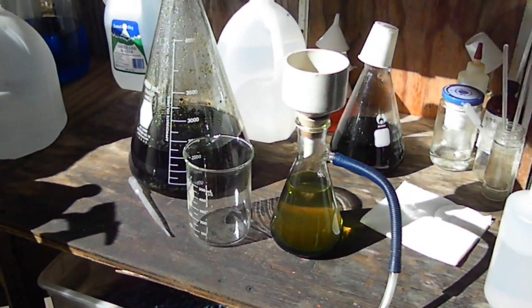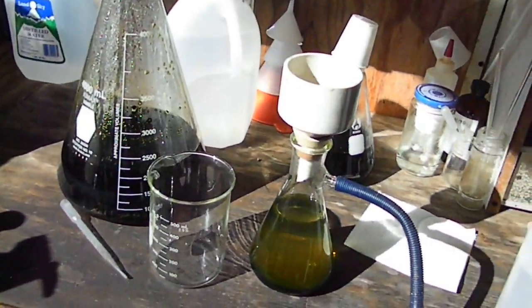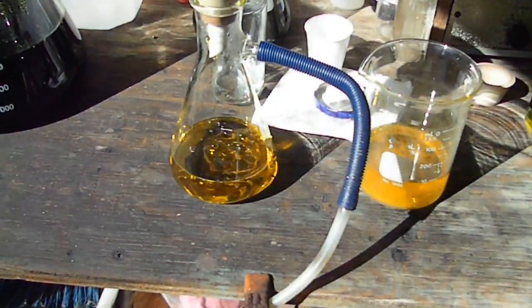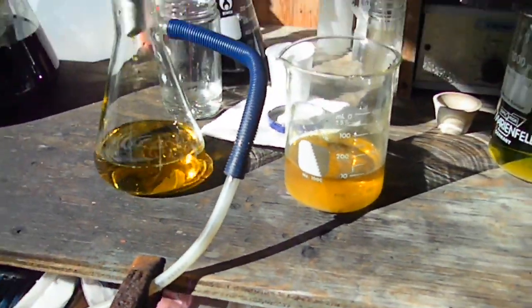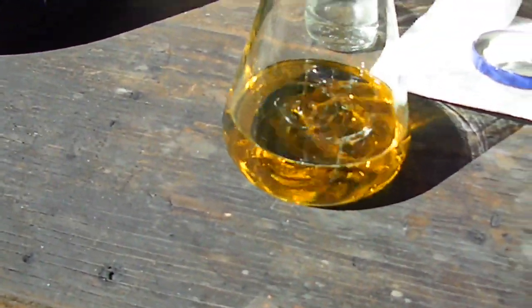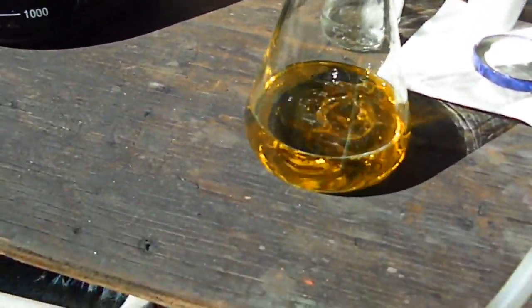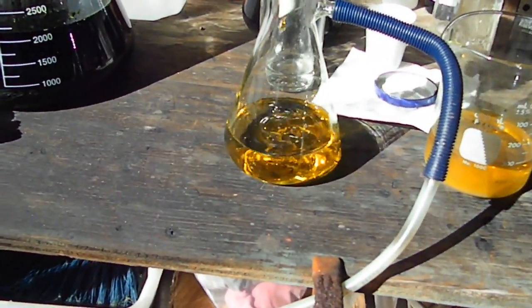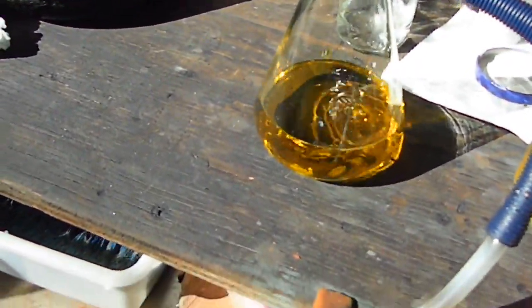It's still another couple more hours of filtering and then we're gonna get this stuff in several different beakers and get it dropped. I just wanted to pop in and show you - I think we've got some lead, probably some lead chloride, settling out. But you can see how hazy this beaker solution is versus what's coming through. This is actually our second filtering of this solution through that filter and we are getting a nice clean clear solution - we're getting all that crap out of there.